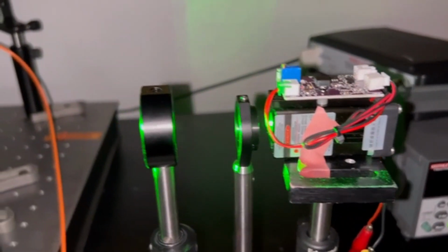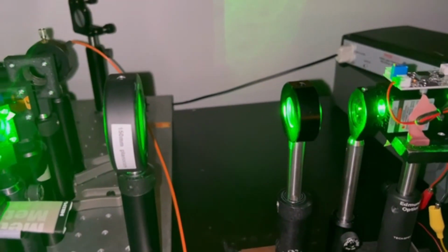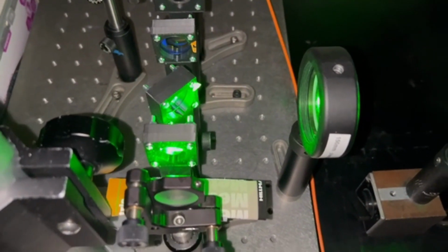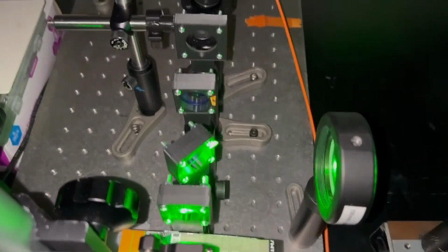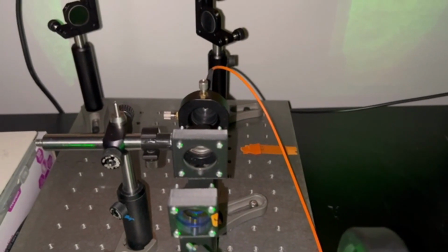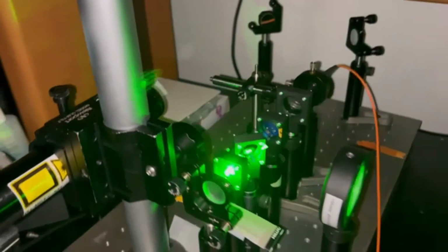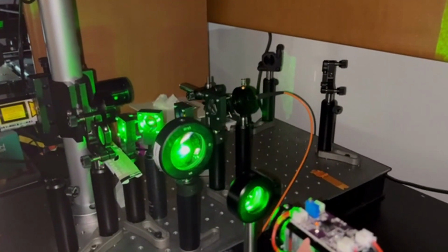After the laser is turned on via user input on the LCD, it is passed through a bandpass filter and then a beam expander setup to clean and enlarge the beam. This beam then hits the 45-degree dichroic mirror and is reflected onto an 18mm focusing lens to create a tight focus on the sample. Any Raman scattering that occurs is recollimated by the focusing lens, passed to the dichroic mirror, then isolated by a long-pass filter. A 75mm focal length lens couples the signal into an optical fiber for the Blue Wave miniature spectrometer. In the final system, our custom-built spectrometer will take the place of this fiber.